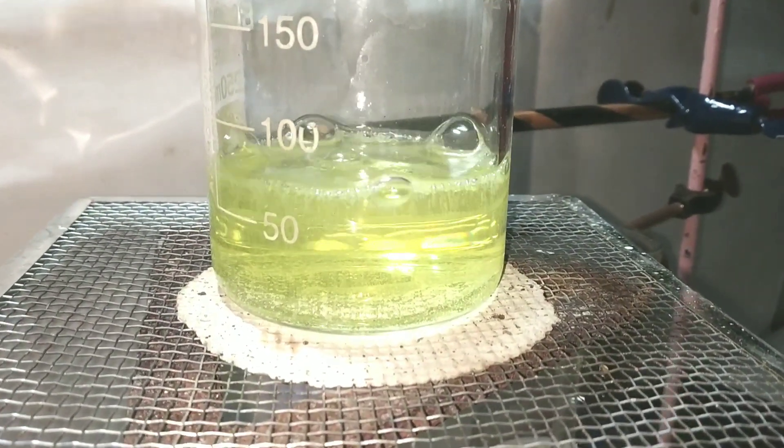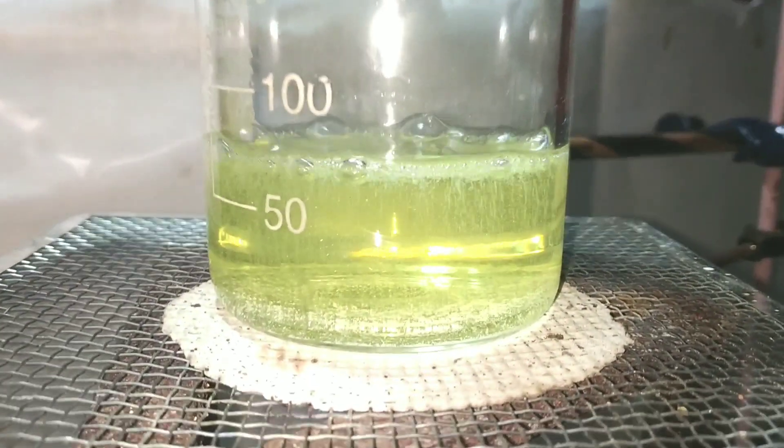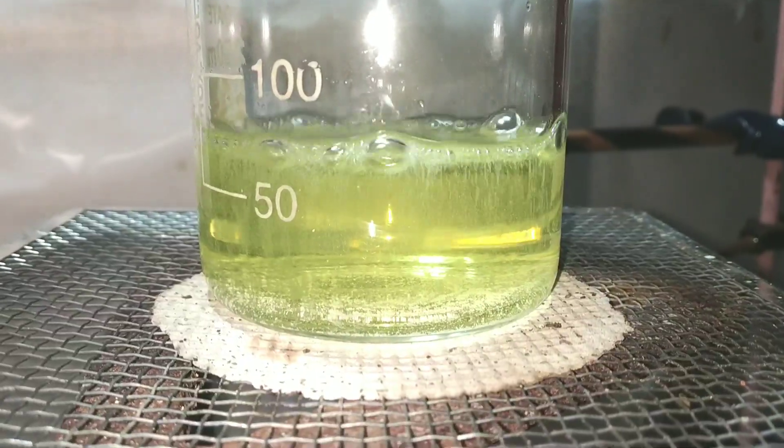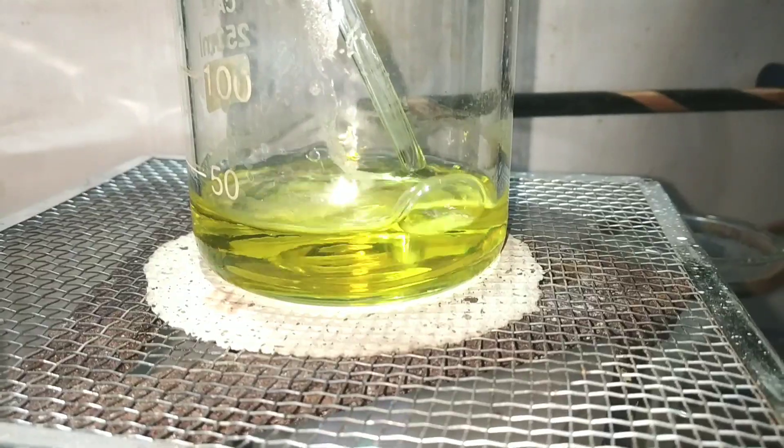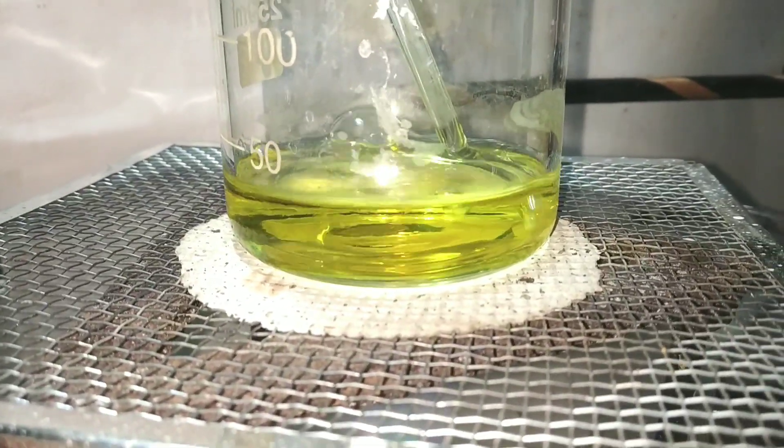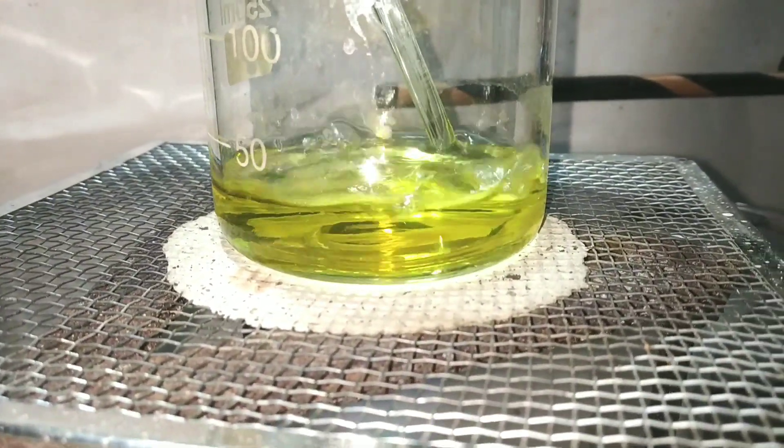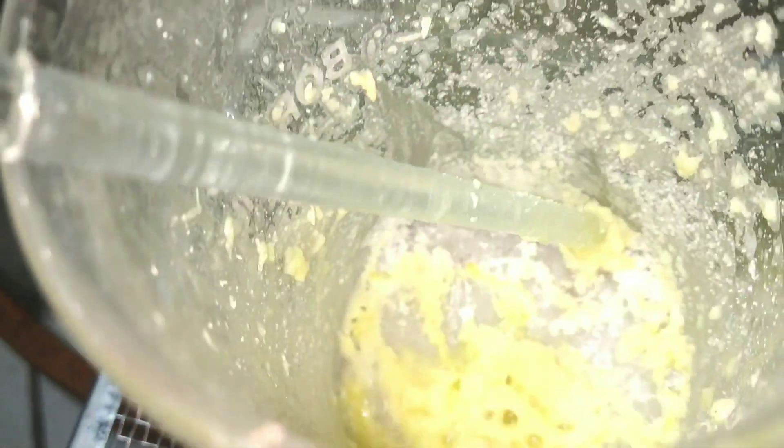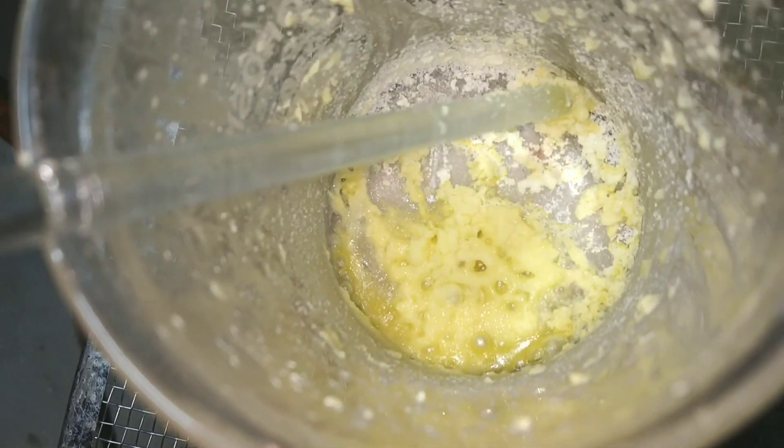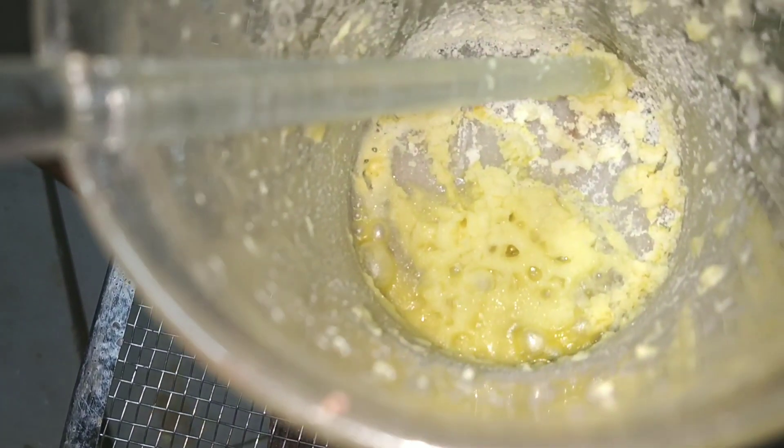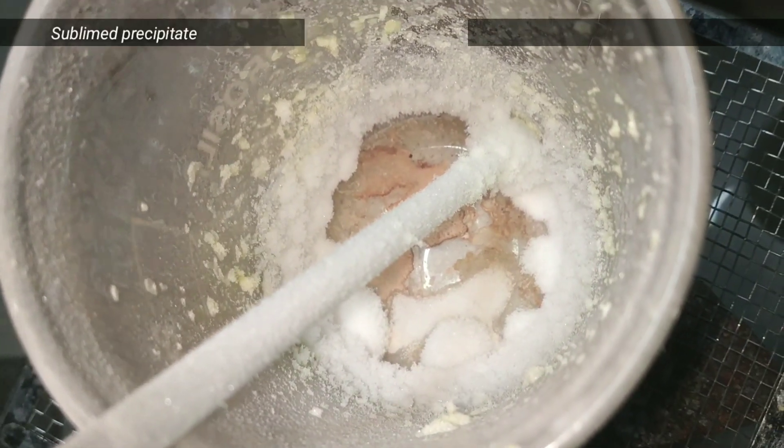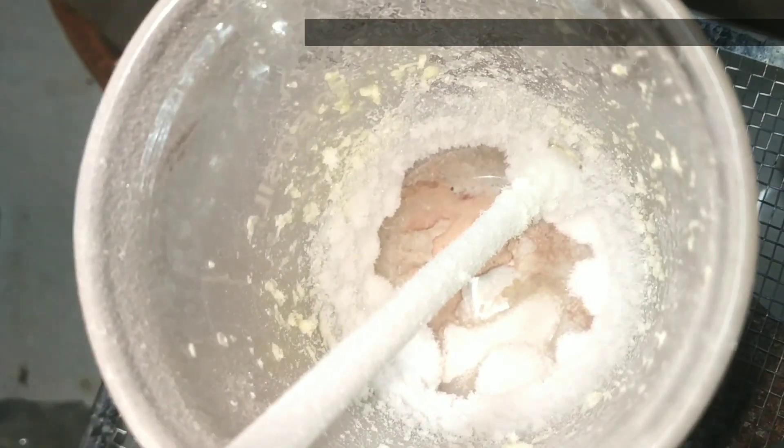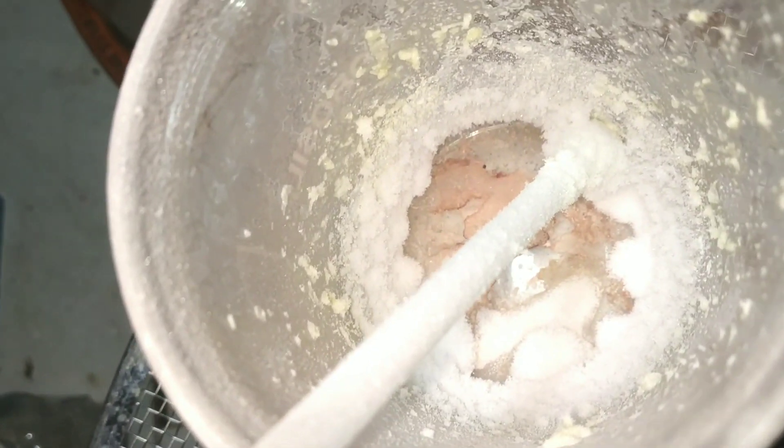Finally, I started boiling the solution. Upon boiling down some water, the solution turned to this yellow color, probably some iron contamination from somewhere. After complete evaporation of water, we are left with this precipitated compound which contains both mercury 2 chloride and some iron contamination. So I let it heat for some more time and you can see that sublimated mercury 2 chloride along the side of the beaker and even on the glass stirring rod which I left inside.